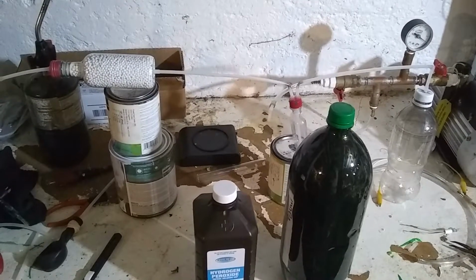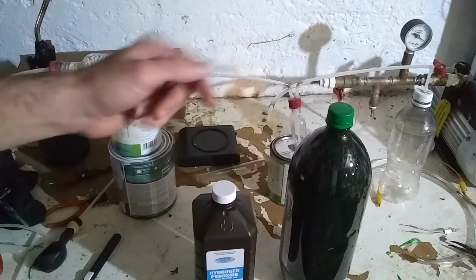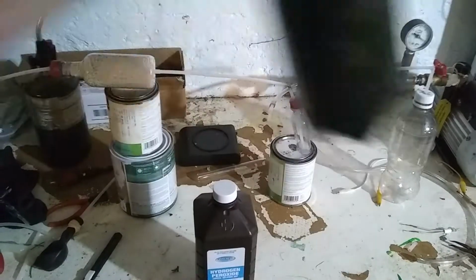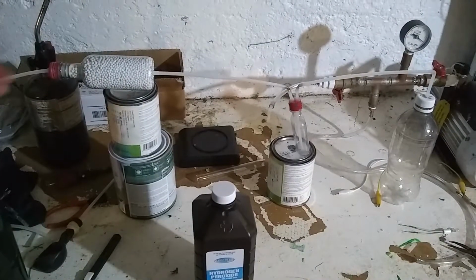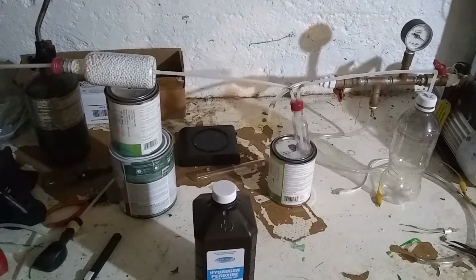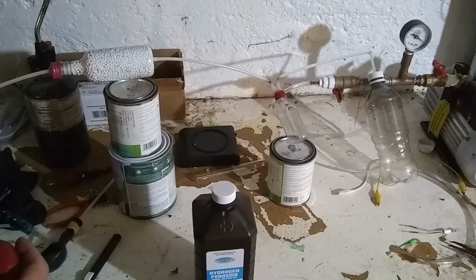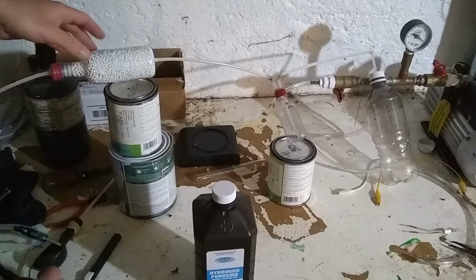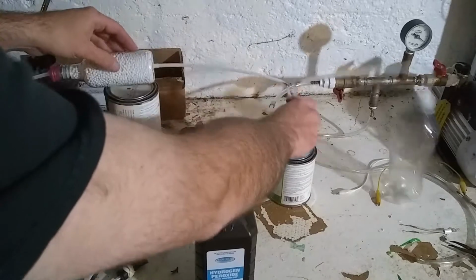Alright, so here is the setup. This is the bottle where I'll be generating oxygen. This is the suckback trap. This is a very large drying tube made out of a bottle. And the usual 2 check valves and a squeeze bulb for pulling gas through the system. Balloon to store the oxygen.